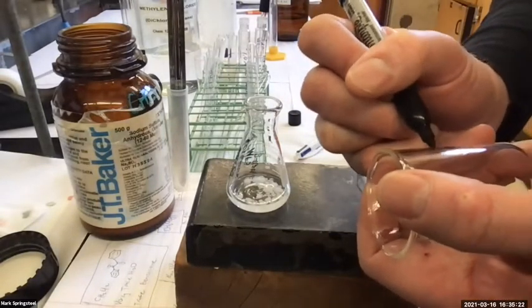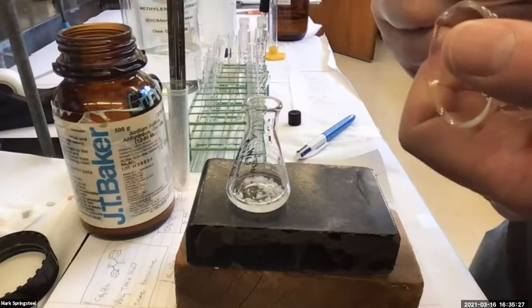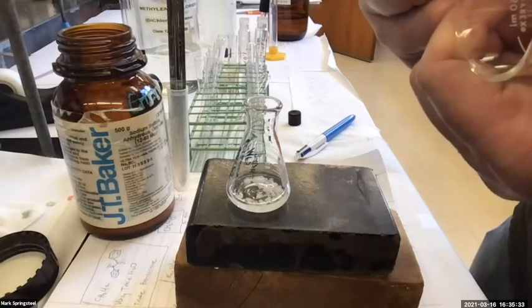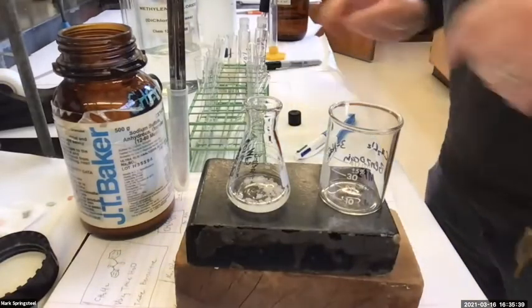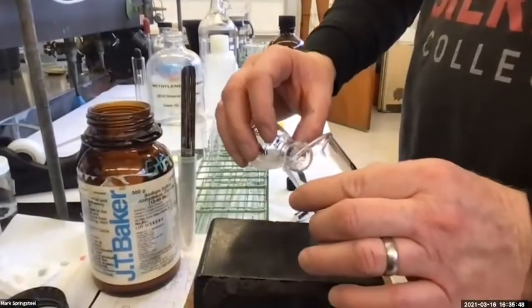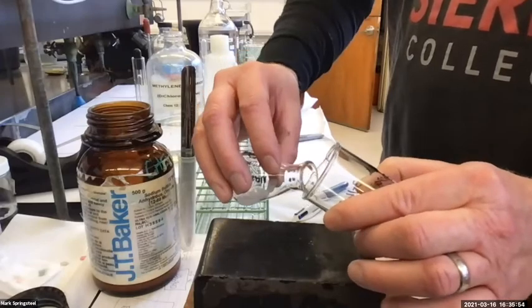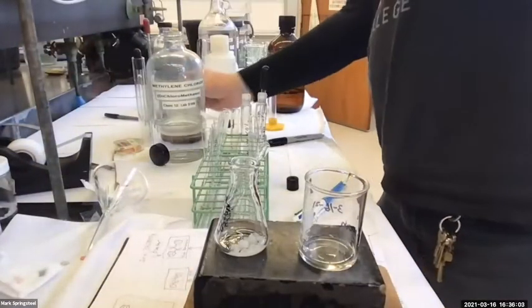All right, so here we go. This is the methylene chloride evaporation, and I've got the benzocaine in here. And my initials, the date. Okay. And how do I get the dry methylene chloride out of here and leave the sodium sulfate behind? You can't. Pour carefully. If you happen to pour a little too steep and some of the sodium sulfate comes in here, just get a new flask and do it again.